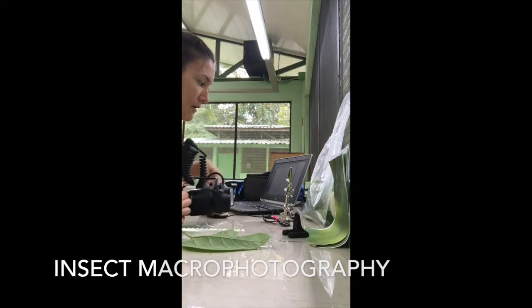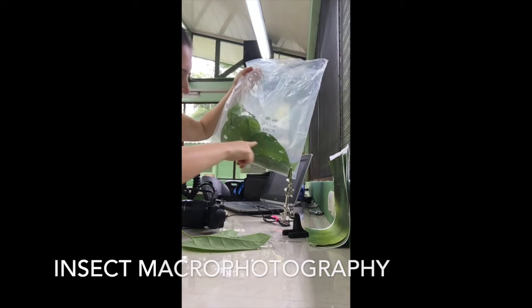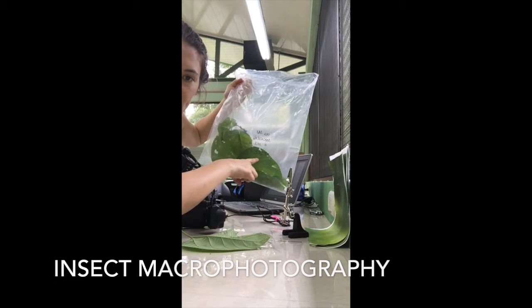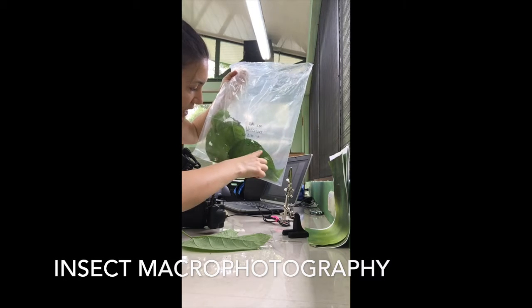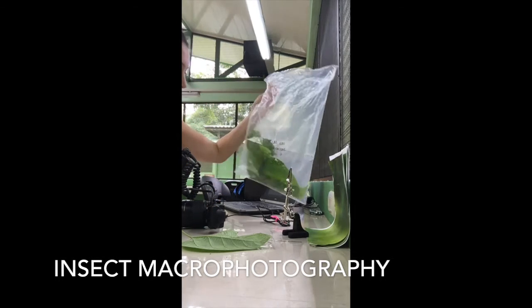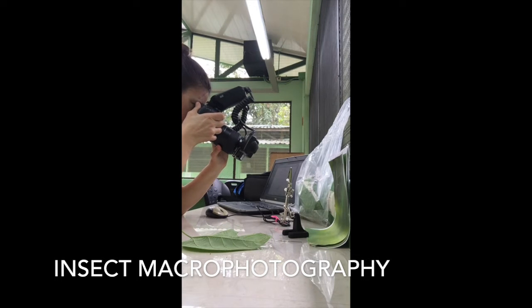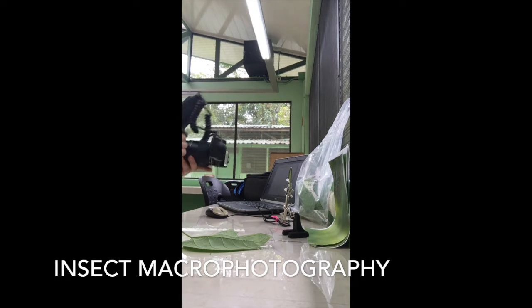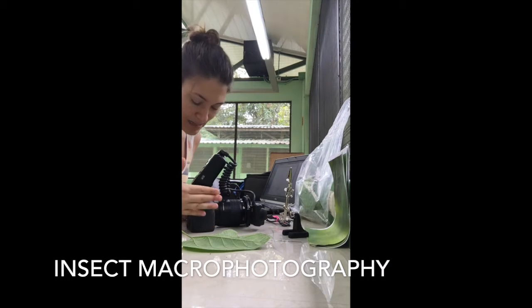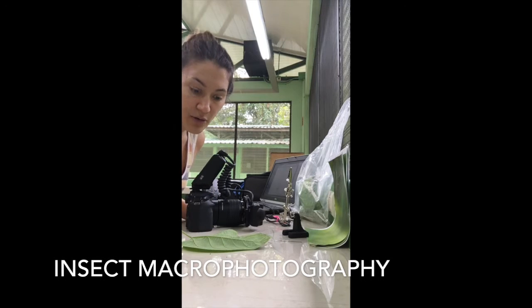Okay, so the first step in this process is we take a picture of the number we assigned yesterday. This caterpillar now has an identity, and I want to record that, making sure that I'm being careful with my record keeping. So we take a picture of this number, and now that number and any picture that follows is associated with that caterpillar. Any picture after that number now corresponds to the caterpillar I'm about to photograph.